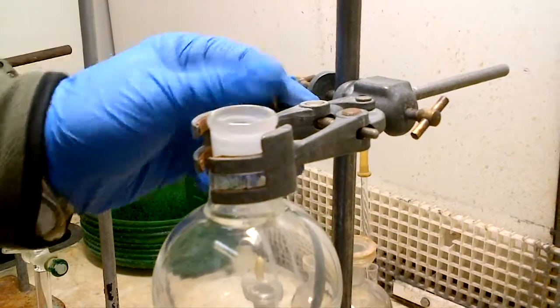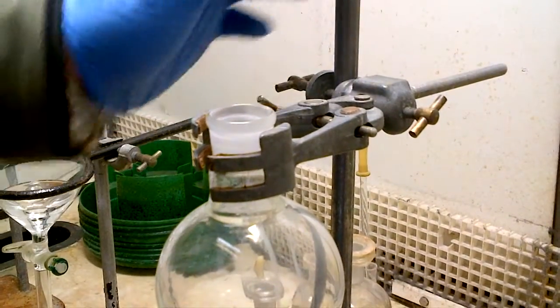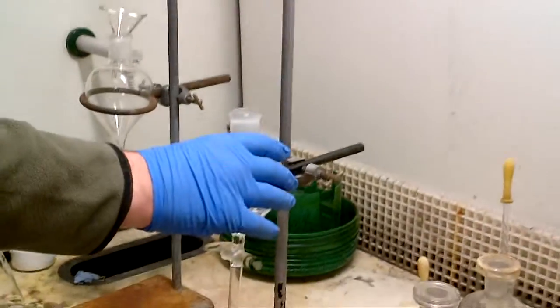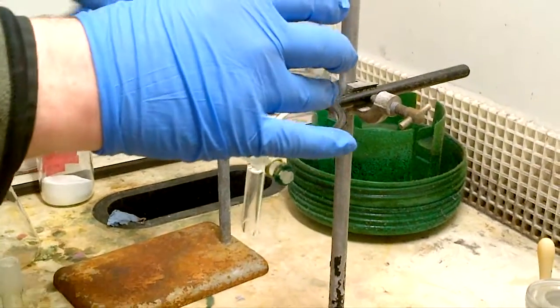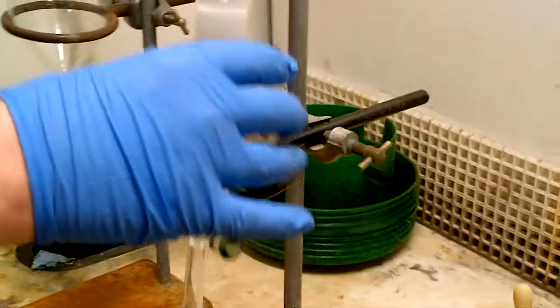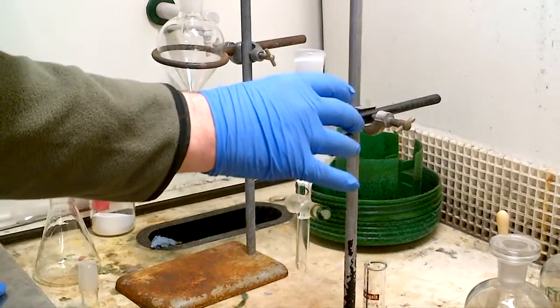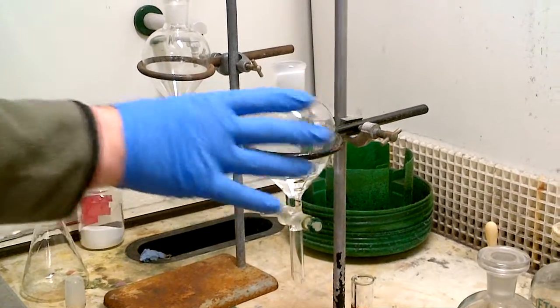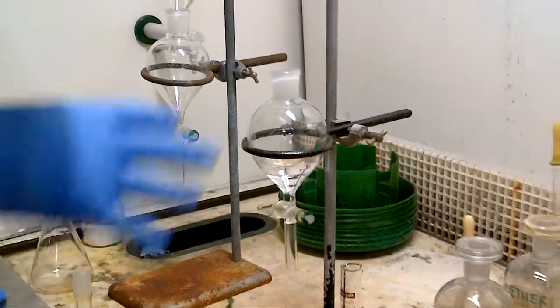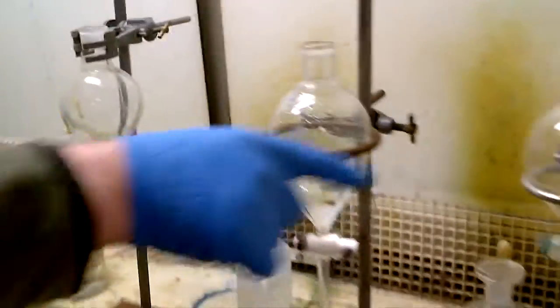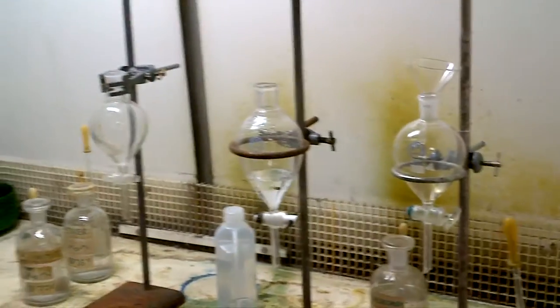Oops, and I nearly dropped it then, didn't I? There we go. So that's nice and secure, but I personally prefer using these kind of O-rings, so you clamp as appropriate and you can quite easily take in and out and up and down and move the glassware out of position quite easily on this one. I prefer using the O-rings. So I recommend trying to get these O-rings in position and clamp them onto the stand.